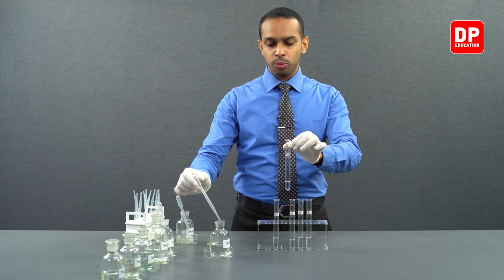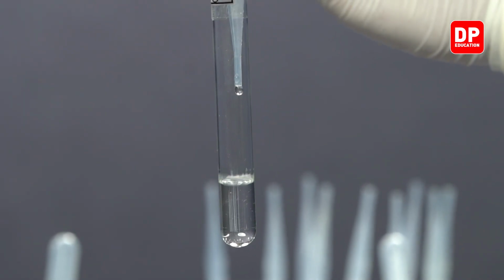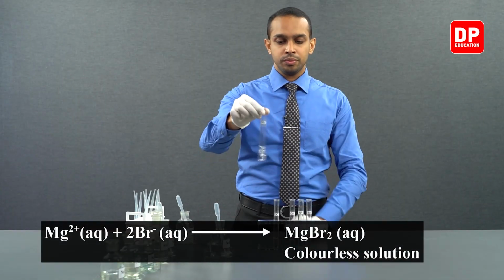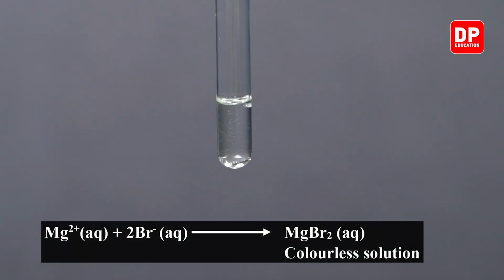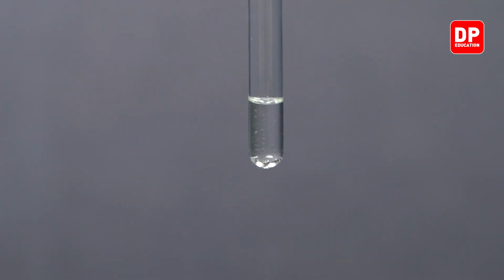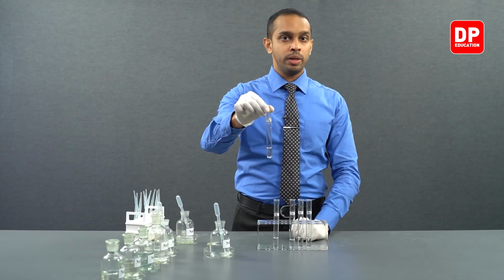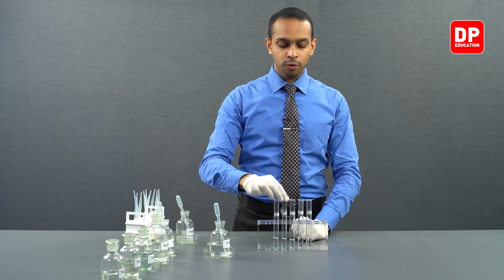To magnesium 2+ ions, I am now adding a small amount of bromide ions. Do you observe a precipitate here? The answer would be no. What you form here is magnesium bromide. Magnesium bromide is also soluble in water, so therefore you will not see a precipitate formed there.